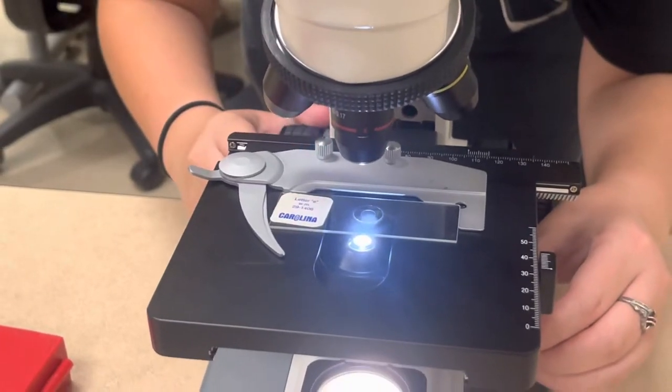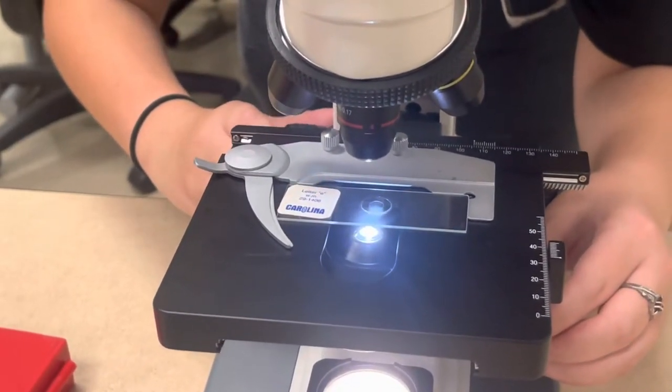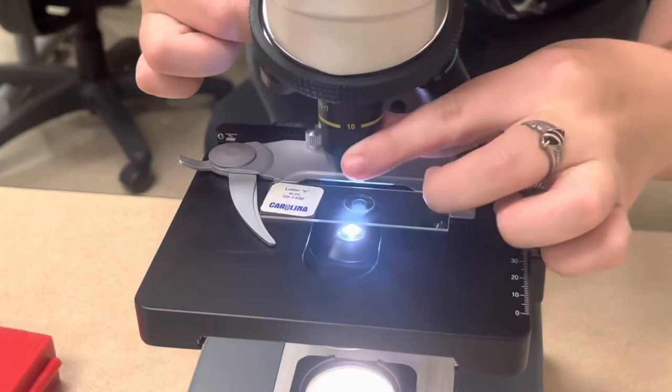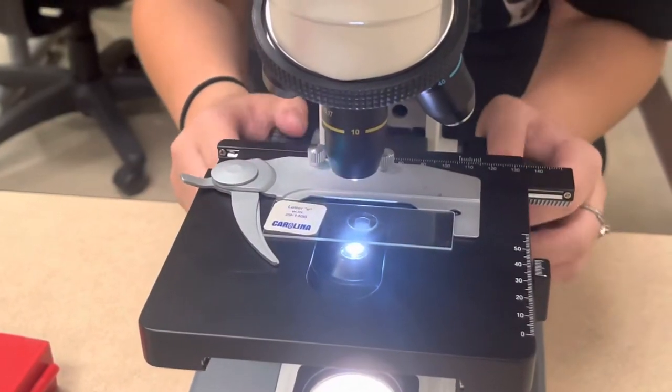Now you're just going to want to make it clear. And then after that, move to the yellow. And then make it clear again. And that's how you do it. Thank you.